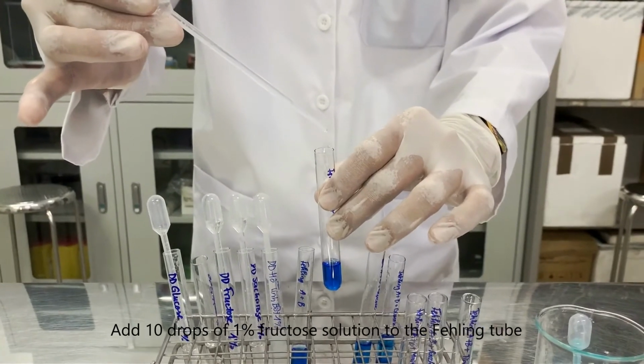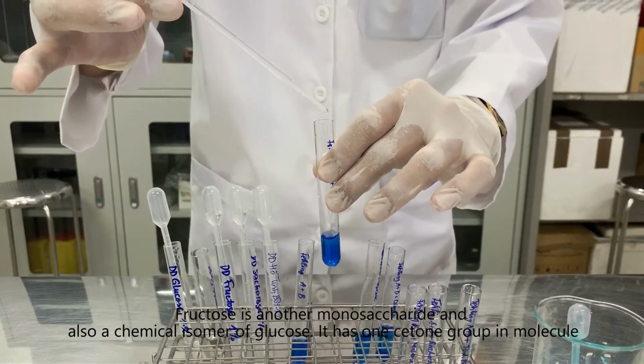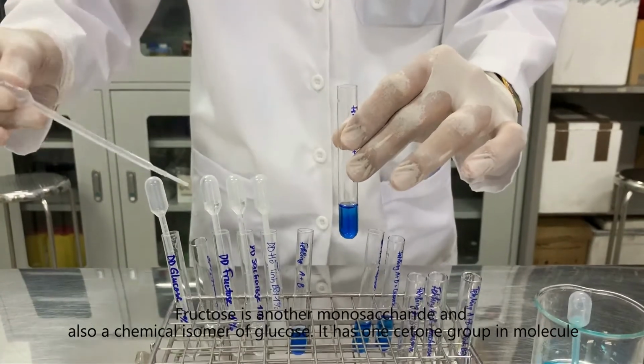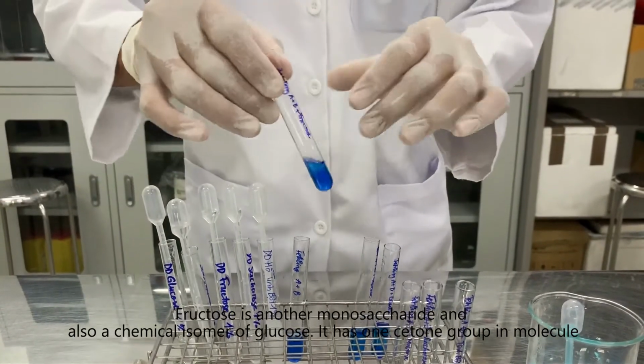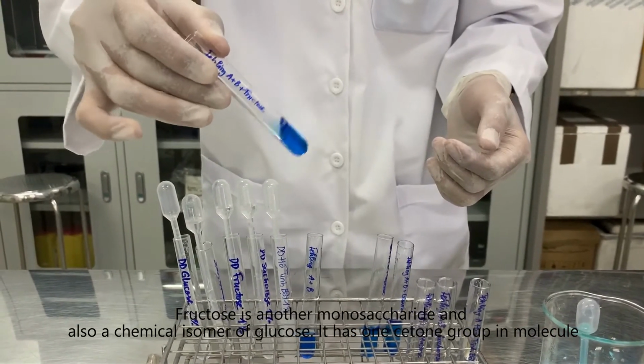Add 10 drops of 1% fructose solution to the Fehling tube. Fructose is another monosaccharide and also a chemical isomer of glucose. It has one ketone group in its molecule.